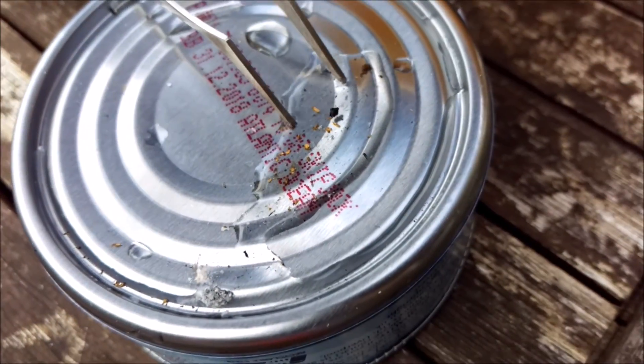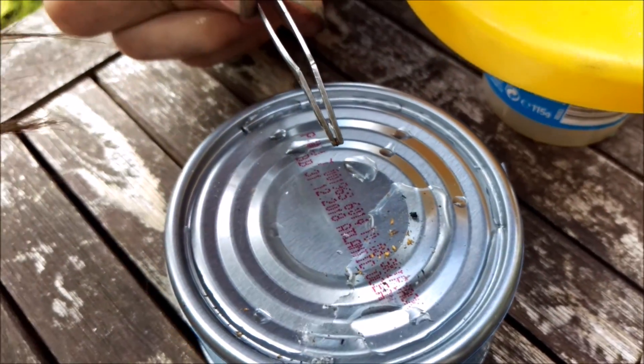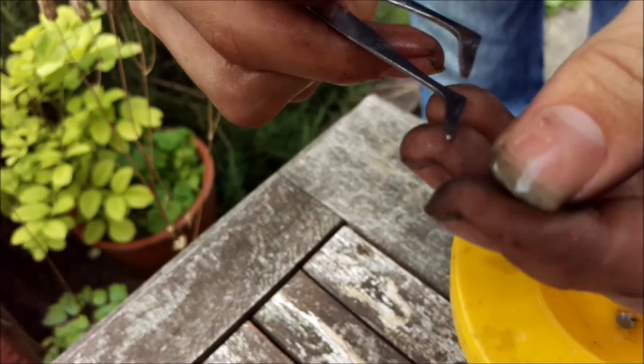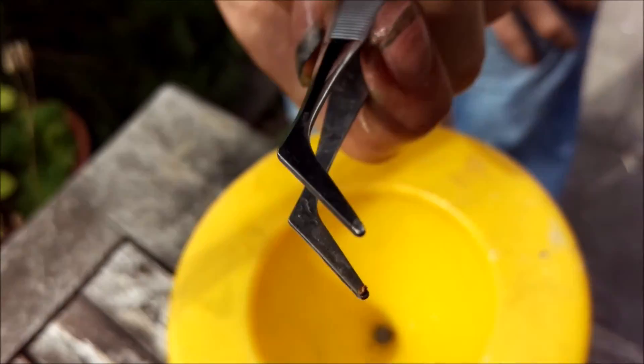That piece of gold has been cooled — that's the largest piece we're going to get. If I get this, this is hopefully a solid piece of gold. It is a solid piece of gold. If I just roll that around in my hand... it was too small to focus the camera on manually, so we got a microscope and pointed the camera down the lens. We have a couple of images of the gold — not the best quality, but it shows the gold up close.